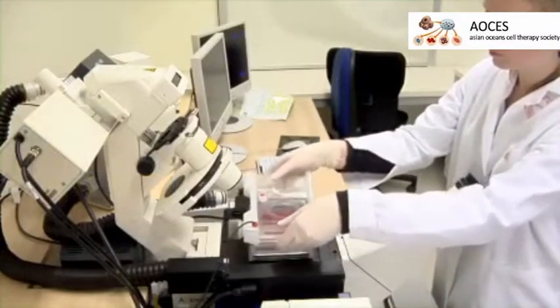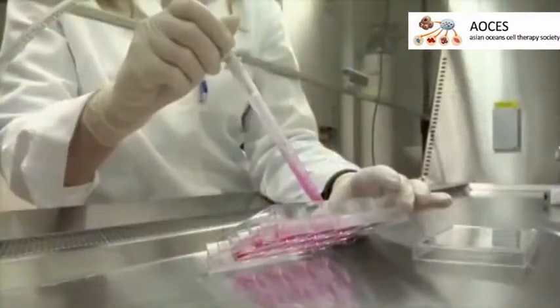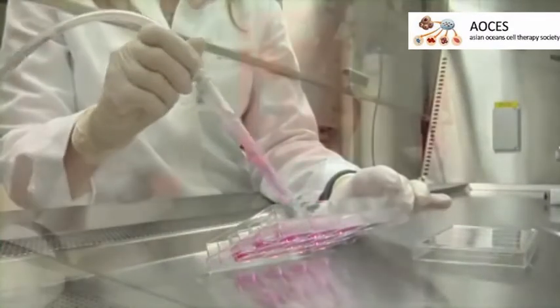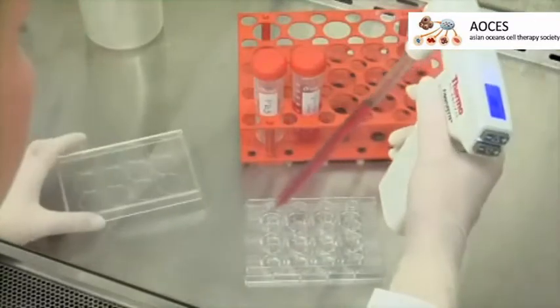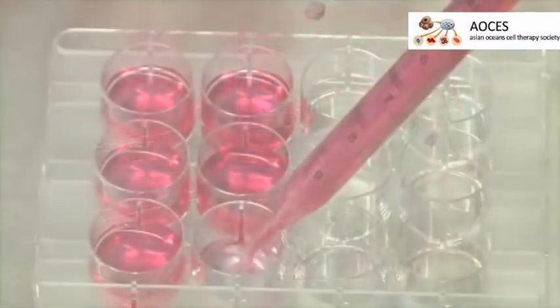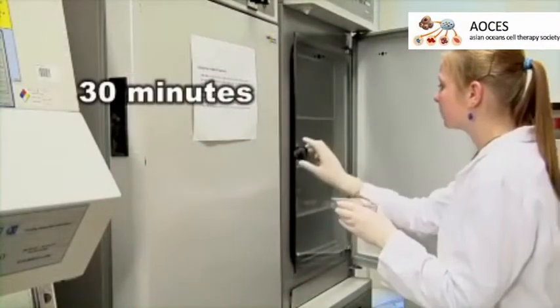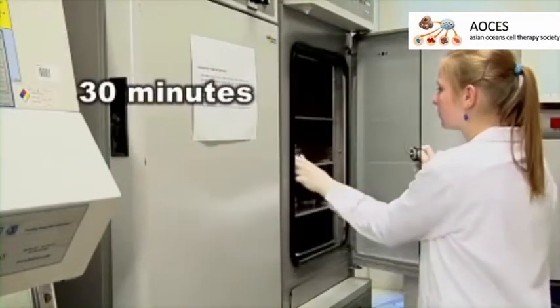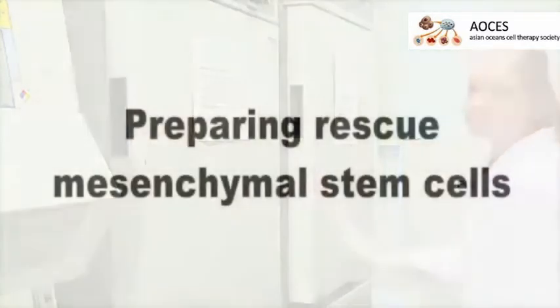At the end of simulated ischemia, remove the glucose-free medium from the cells. Pipette normal culture medium to the wells. Place the 12-well plate for 30 minutes in the 37-degree carbon dioxide incubator. This is the reperfusion period.